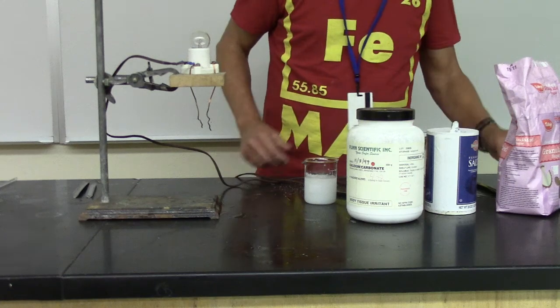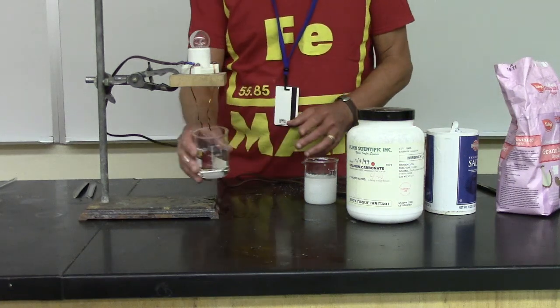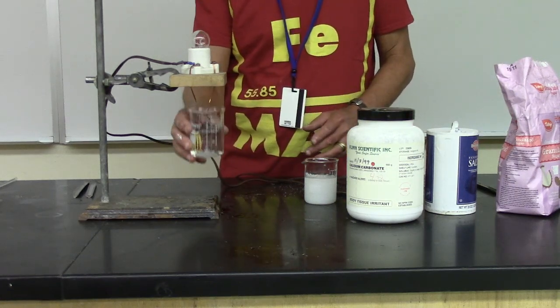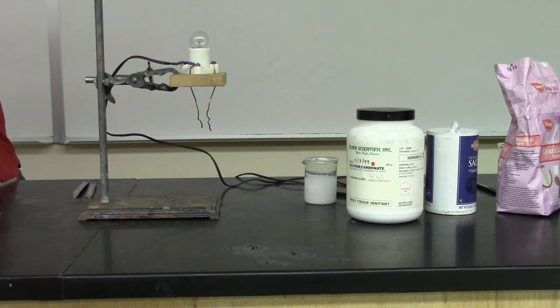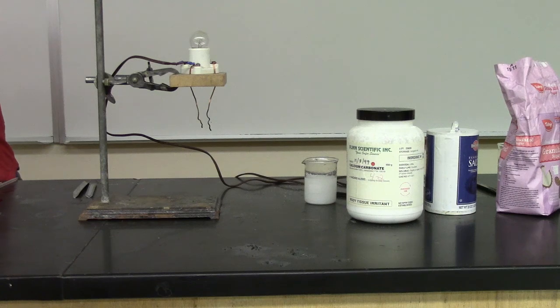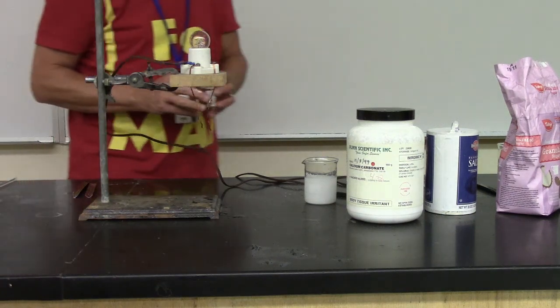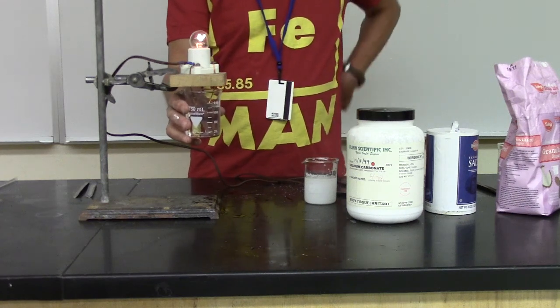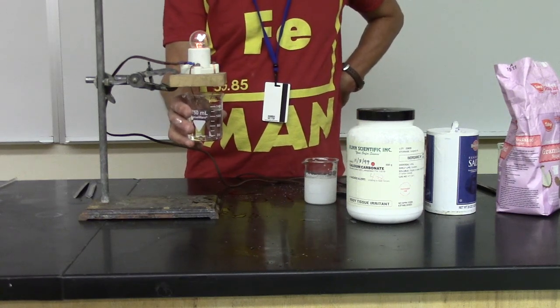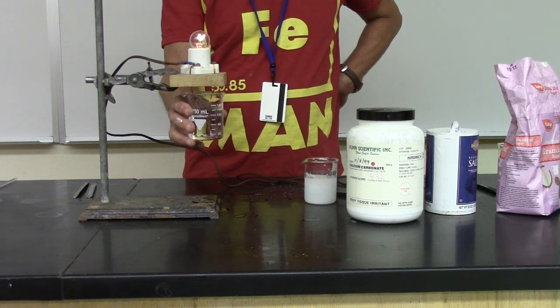Let's try one more thing. Let's do a little rinse here. Let's try one more. I'm going to come over here out of your viewpoint and get some tap water. This is Bella Vista tap water from the Bella Vista Water Company. And we'll see what happens there. And again, look at that. It must have some electrolytes in it also. So tap water is not pure water. It has electrolytes in it.